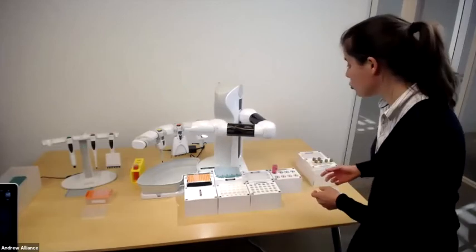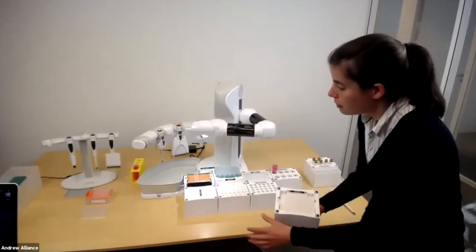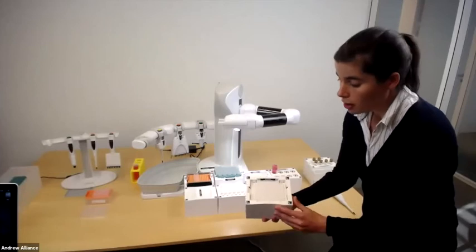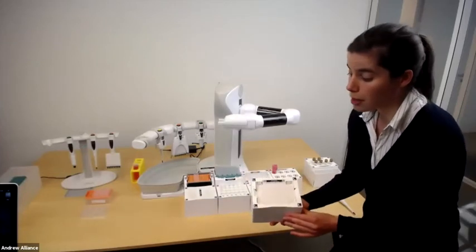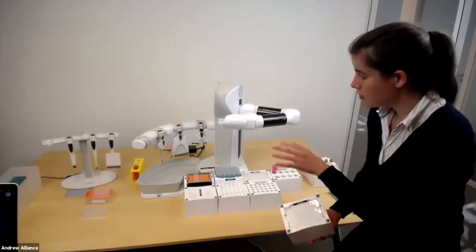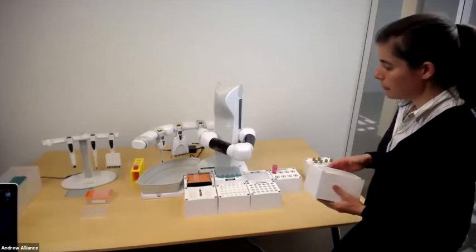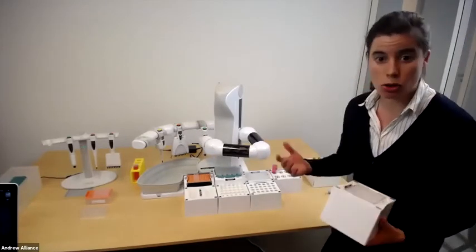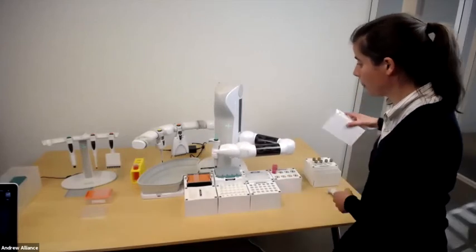So for example, I'll give you an example just to touch. You see there are different blocks around the Andrew Plus robot. We call them dominoes, and they all have different barcodes associated with them. And what that means is this gives Andrew Plus a really good idea of where everything's situated. And without further ado, Andrew just checked the whole lab bench. Everything's good to go. We have enough tips. We have our consumables. Everything's ready.